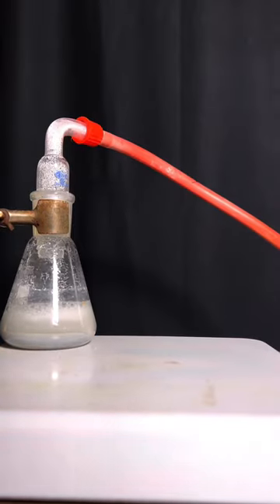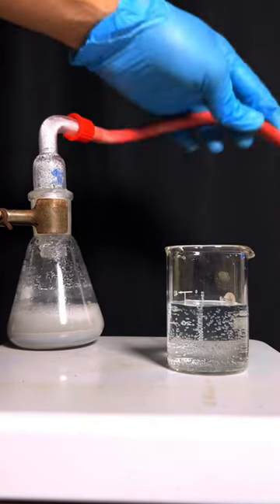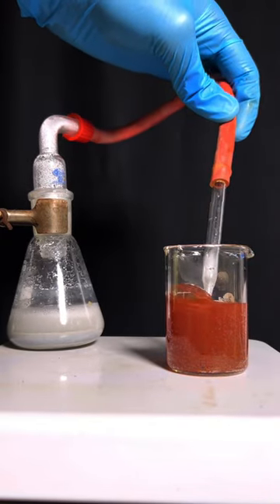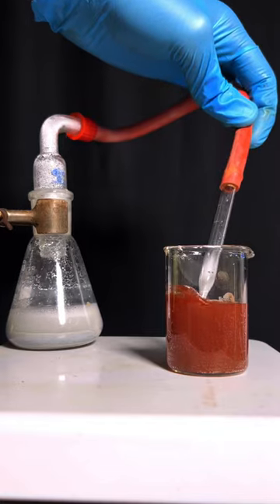Acetylene gas reacts with copper-1 complex to produce copper acetylide, which is a reddish brown precipitate. This compound copper acetylide is interesting because of this.